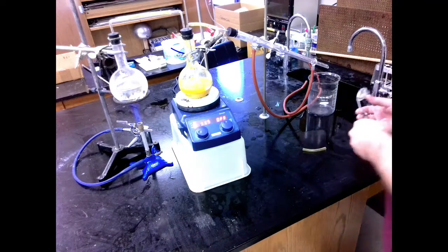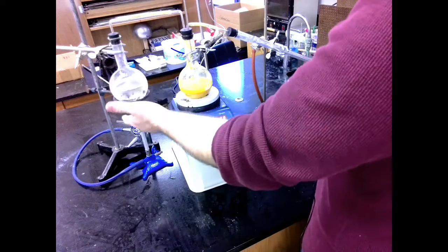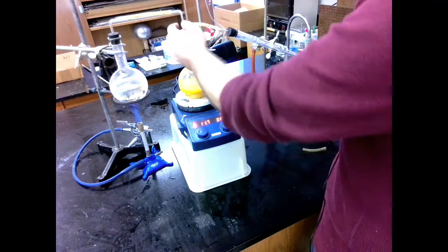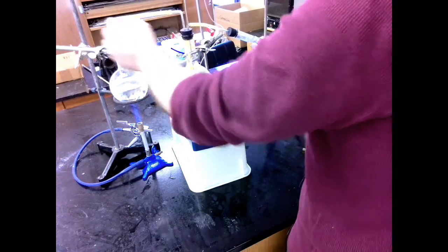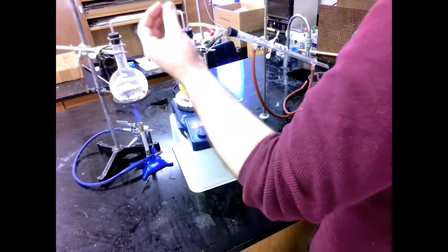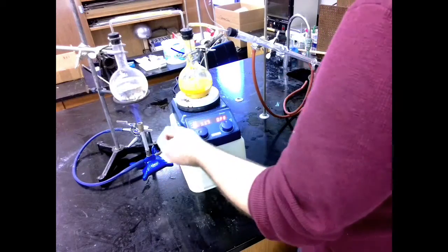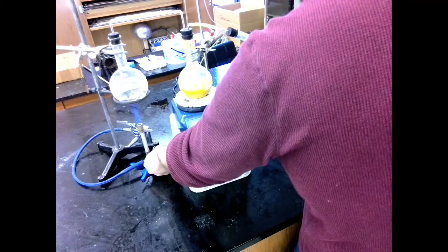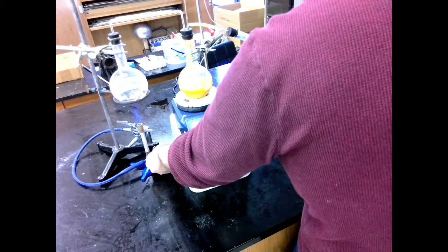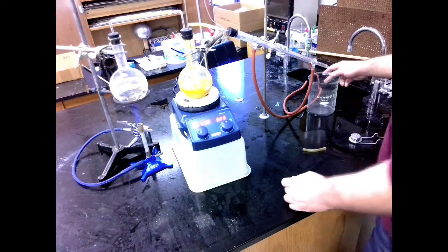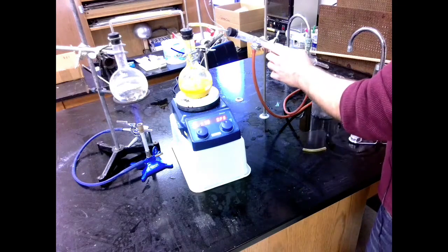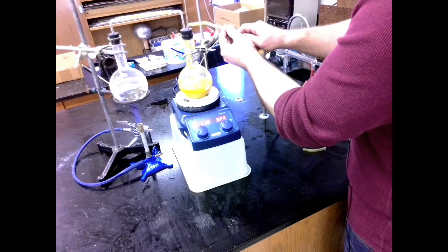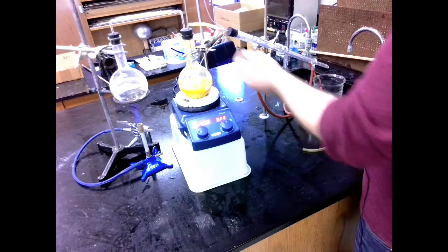And now I'm just going to monitor the setup. Take a look at how things get started. As this starts to boil, you're going to likely see a lot of movement in here. You're going to see this bubble up and kind of burst up. Make sure that your corks are all on solid. And as this starts to boil, I highly recommend bringing the flame down to give it a gentle boil. Once we get going, you'll start to see condensation on the inside of this tube. You might see a milkier substance. That would be the orange oil that is produced.